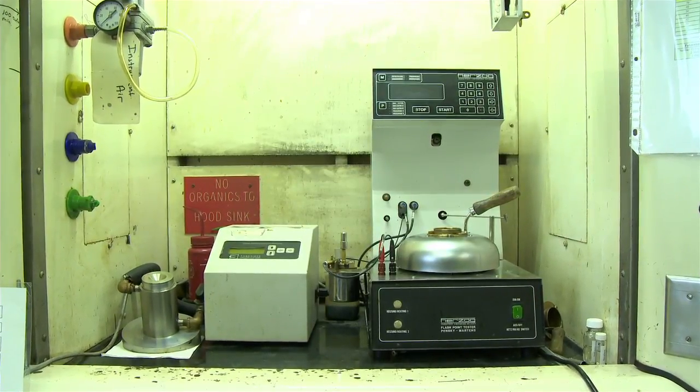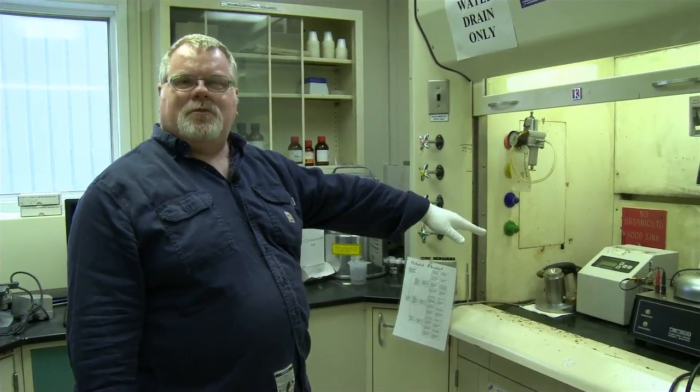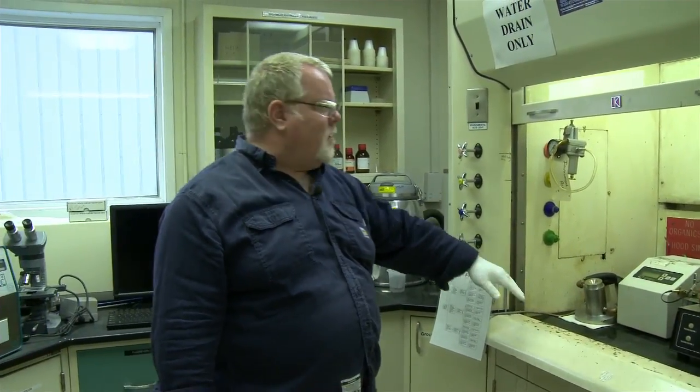And basically we can run viscosity from 2 to 10,000 with this instrument, 2 being the lowest, very light stuff, 10,000 practically being a solid. And that's it. We can do it at multiple temperatures. We have a water bath that circulates through the instrument, and we can set it for a particular temperature and then do it at essentially whatever temperature you need, within limits on the low and the upper end.